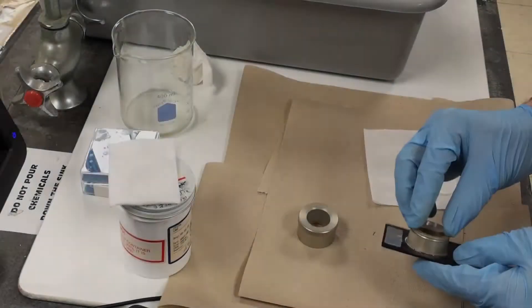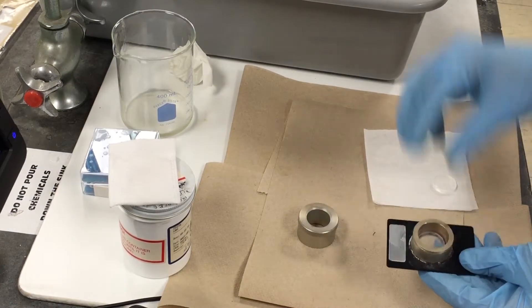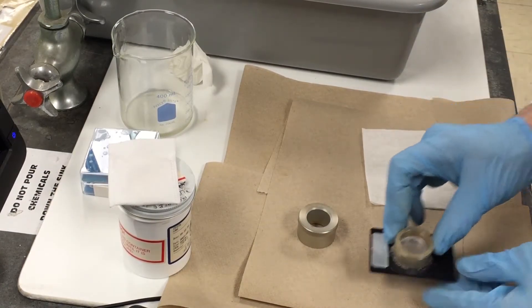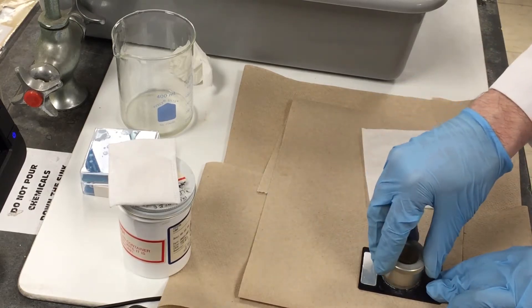First collect a background spectrum. Place the clean, dry salt plates in the holder. Be careful when closing the holder, too much pressure will crack the plates.